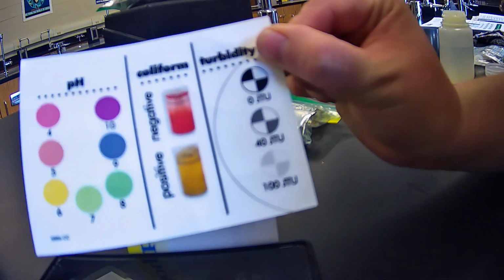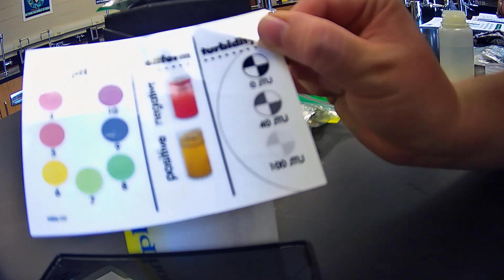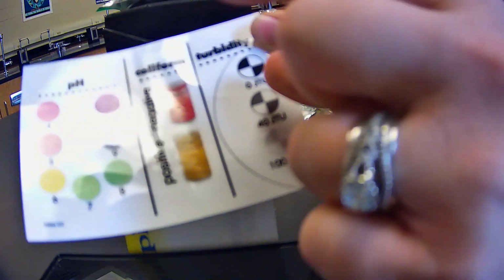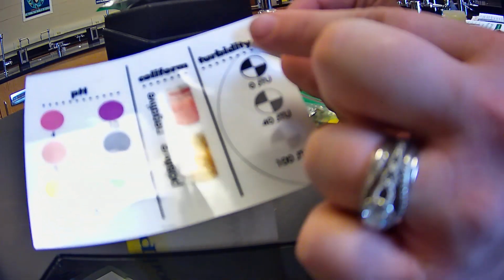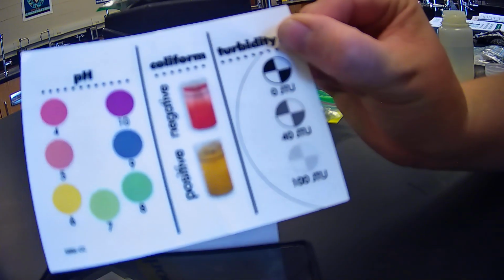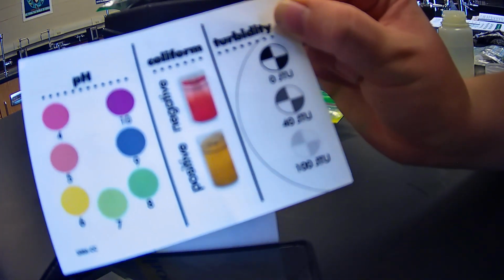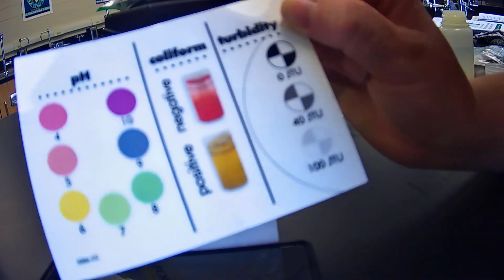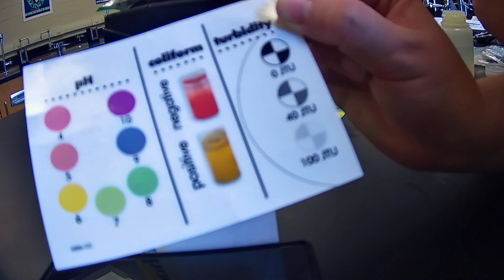What these black and white things are called are Secchi discs. Basically you take a sample of water and you hold it above there and you let it out until you can't see it anymore. Once you see that value, that's how many particulates in that suspended column would be in the way. That's why you can't see the bottom of the lake, right? You have so many different particles, and so you'd be able to tell the turbidity there. So that's all we have for turbidity for this video, but we will be testing for it later.